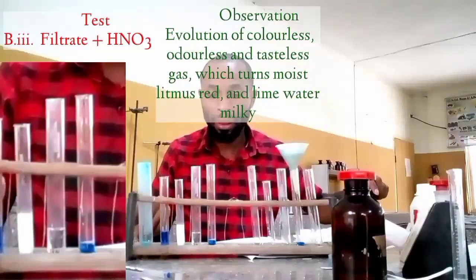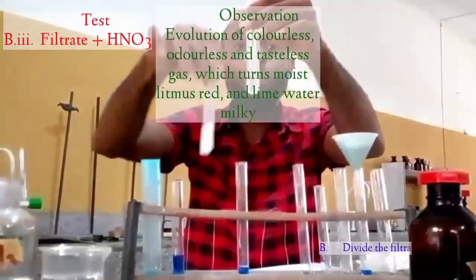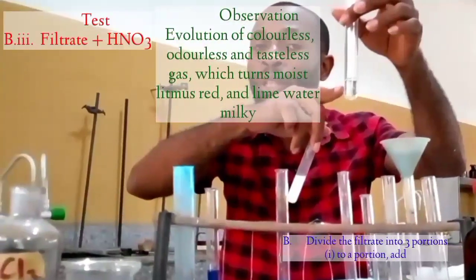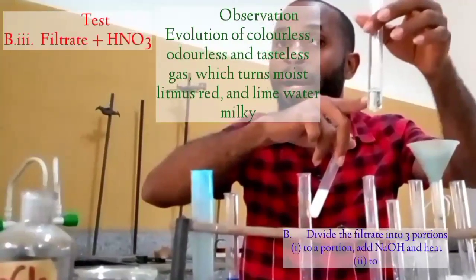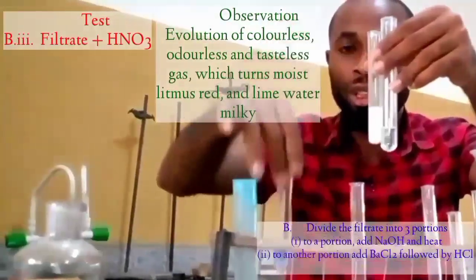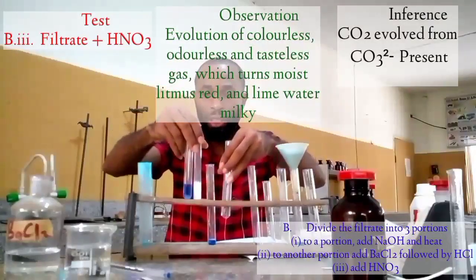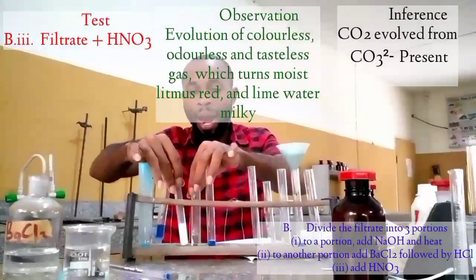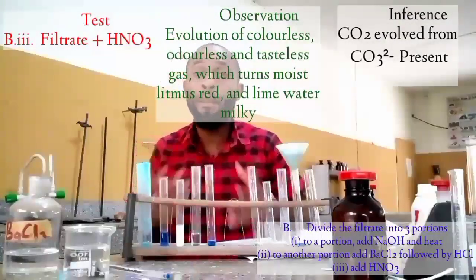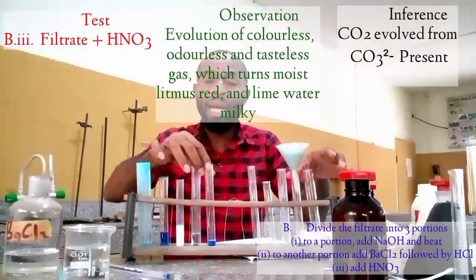That is evolution, and we have a colorless gas here. We have a colorless gas that turns blue litmus paper red and turns lime water milky, and you can see the change compared to the changes here. Okay, I believe I am done with the filtrate commands. That is what they are going to ask us to do with the filtrate.